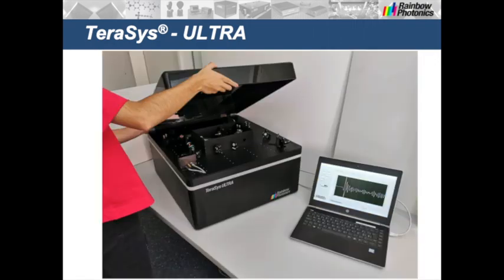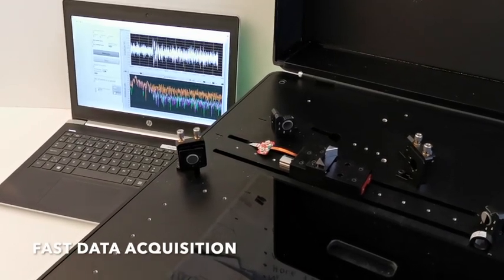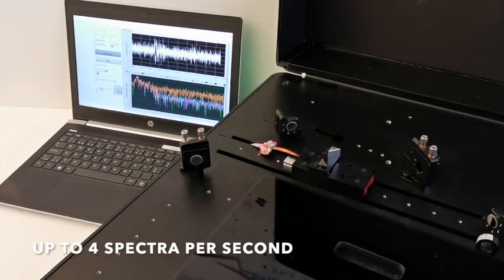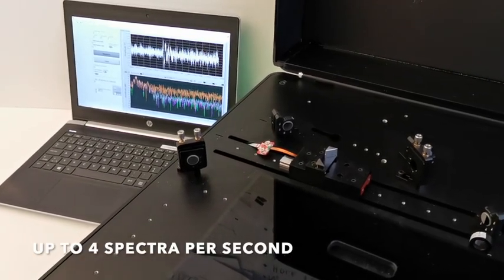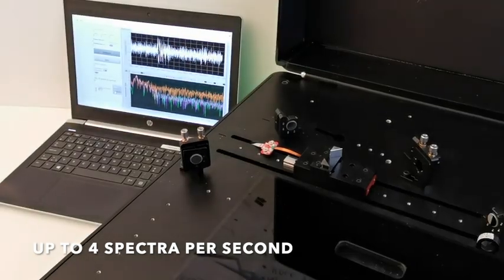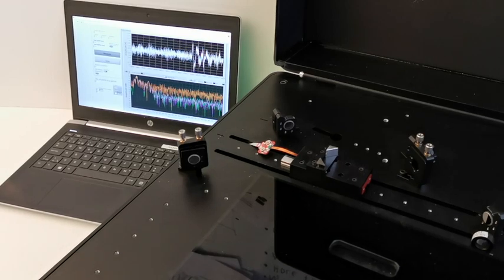In case the device with laser needs service, access is easy just by opening the cover. Here you see the device in full operation in real time. To better illustrate the speed of the measurement, we open the cover to see the movement of the delay line. Measurements can be done at a speed up to 4 spectra per second. The software calculates the THz spectrum in real time. You can stop the measurement and save the results as soon as you reach the precision required.